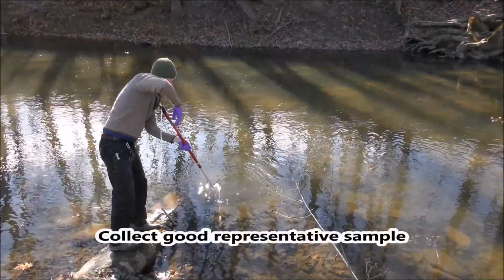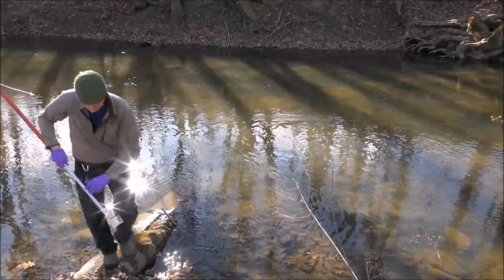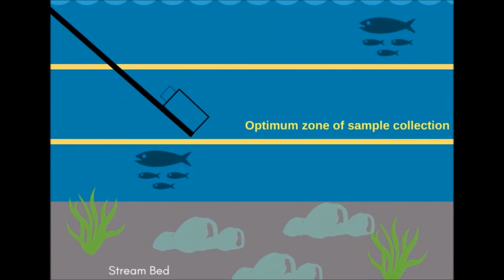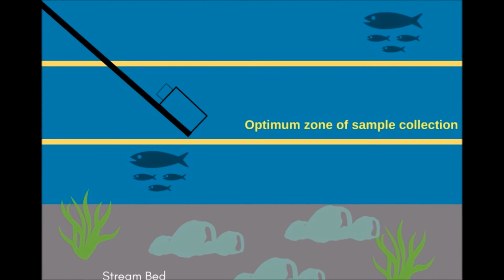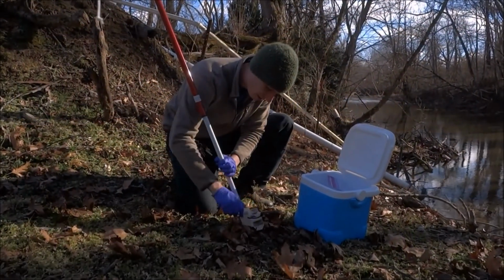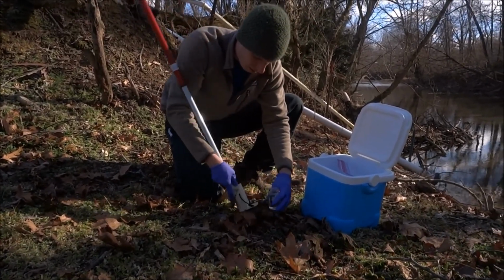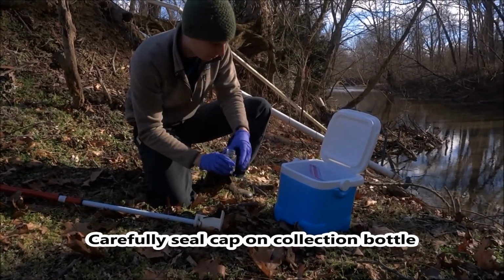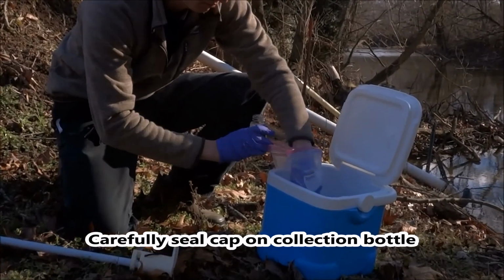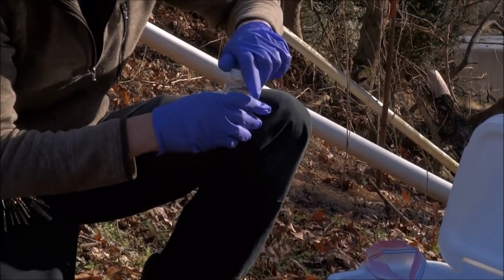Use the dipper stick to collect water away from the shoreline, beneath the water surface, yet above the bottom of the source. Remember, the goal is to get a good representative sample and avoid stirring up the water, which could potentially skew your test results. If you do not need a dipper stick, you can simply use a grab sample of the surface water source. When the collection bottle is full to the fill line or shoulder, seal the container by carefully replacing the cap and tightening. As previously mentioned, do not touch the inside or lip of the collection bottle.